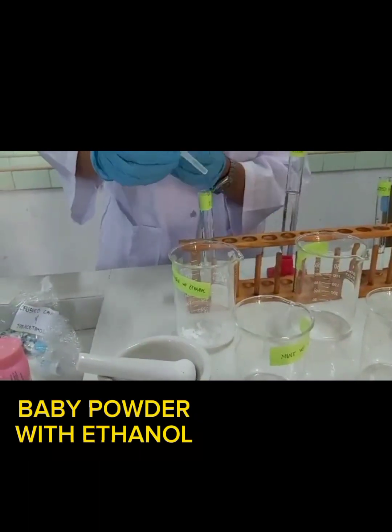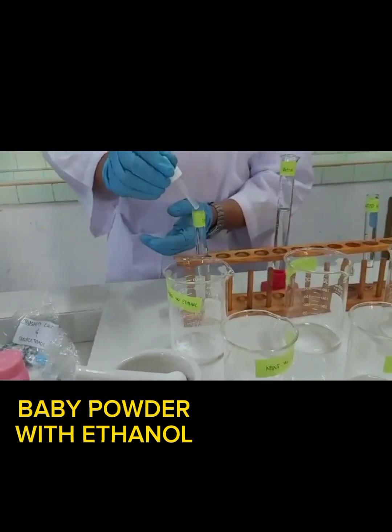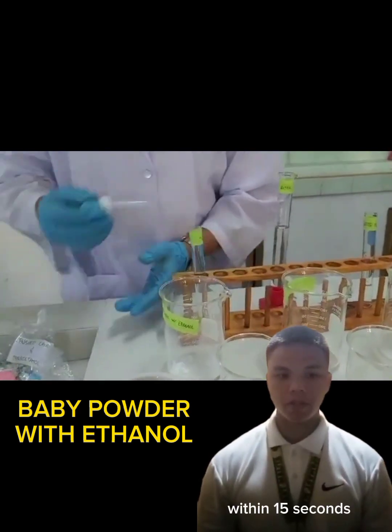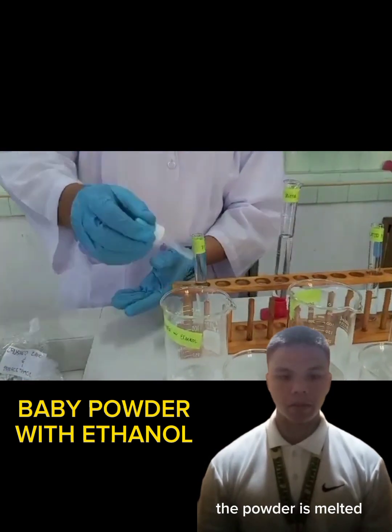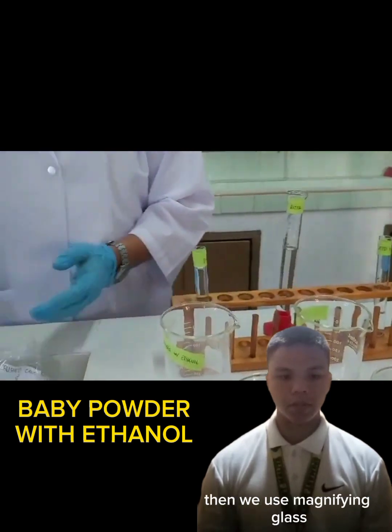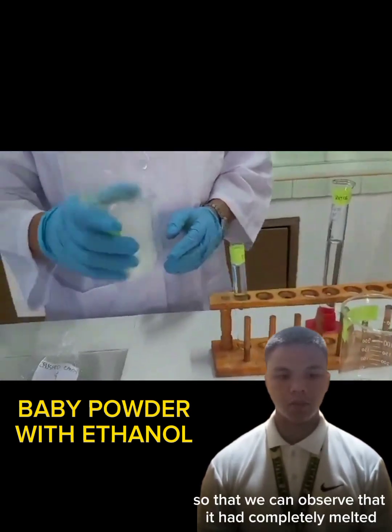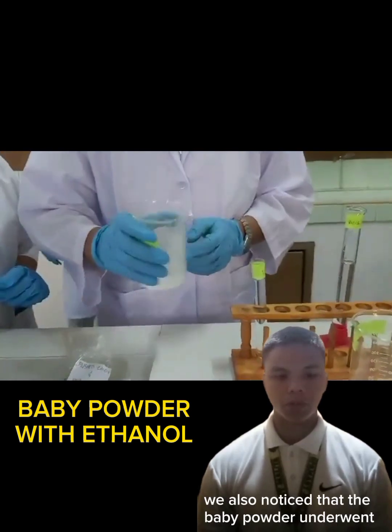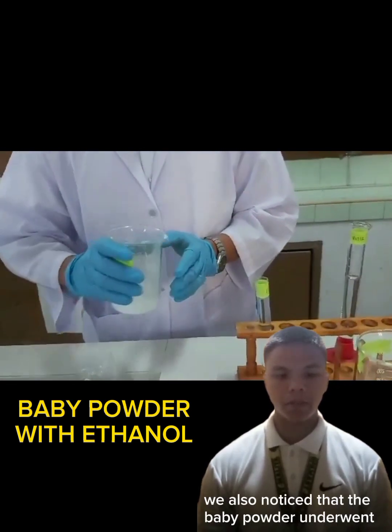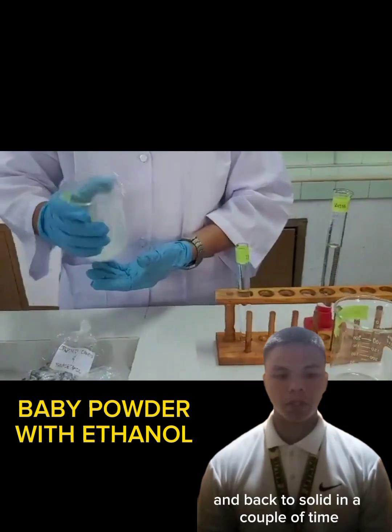Baby powder with ethanol. Within 15 seconds, the powder is melted. The powder substance solidified within 30 seconds. Then we use a magnifying glass so that we can observe that it had completely melted. We also noticed that the baby powder underwent a physical change from solid to liquid and back to solid a couple of times.